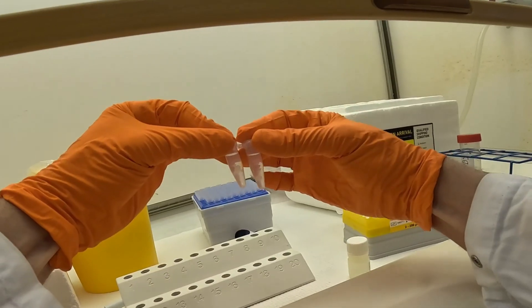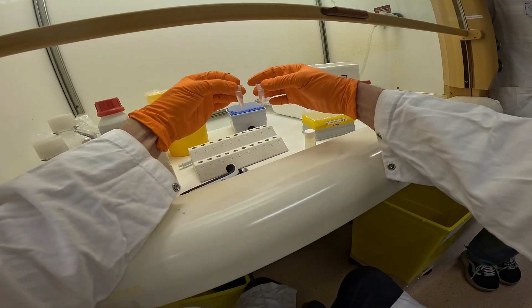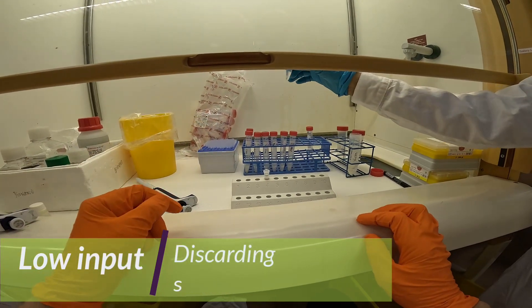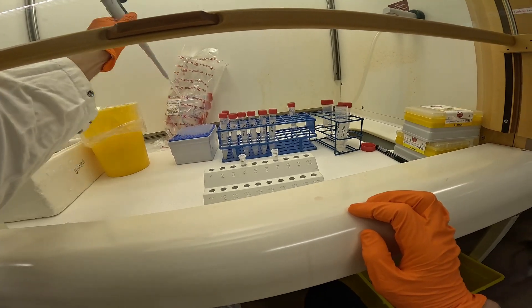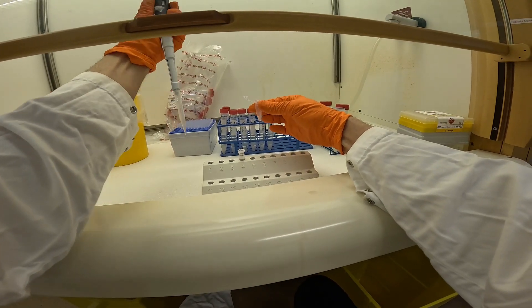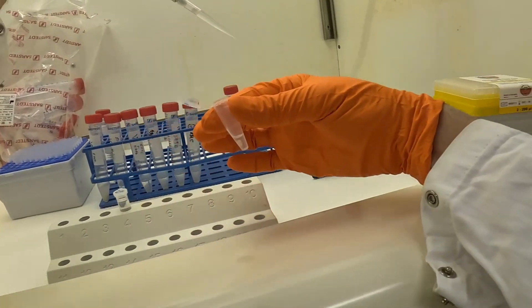The difference now is that this tissue is cross-linked prior to any crushing, so later on we are crushing it with the power mashing inside this tube. Incubation for five minutes with the stop solution. For low input, the pellet — we can't discard it like the other samples, so Morten is going to pipette and discard the supernatant. Instead of spinning and getting a pellet, we pipette off the supernatant directly, because this is not crushed yet. The whole idea is to keep the sample in the tube.